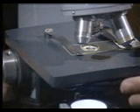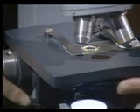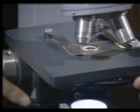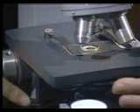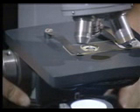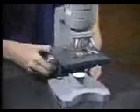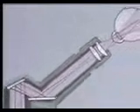The hole in the stage is designed to allow reflected light from the mirror beneath the stage to pass through the specimen and into the objective lens positioned above the stage. Some microscopes use an electric light under the stage instead of a mirror. Just below the stage is a disc or iris diaphragm that can be rotated to regulate the amount of light passing through the stage and specimen. The light goes through the specimen and into the objective lens where it is magnified. On the other side of the body tube is the eyepiece, which also magnifies the image.